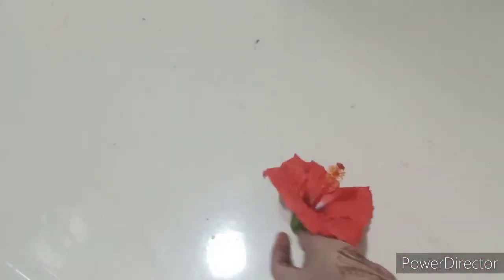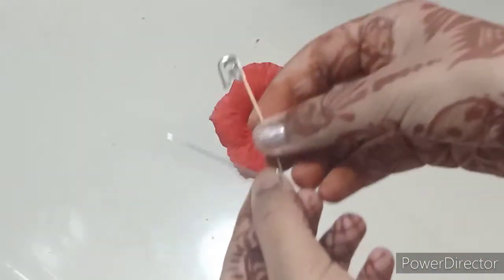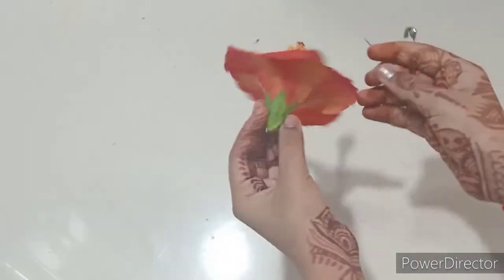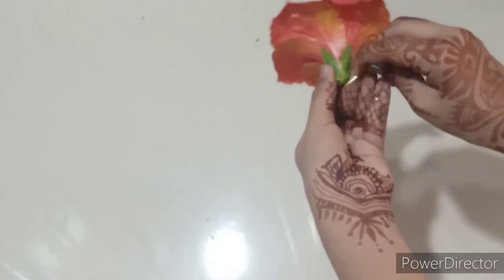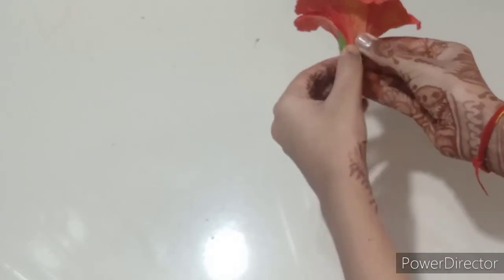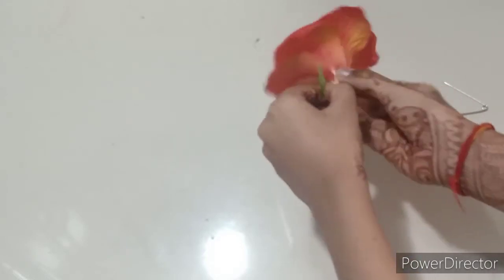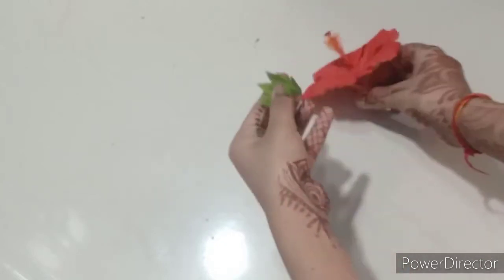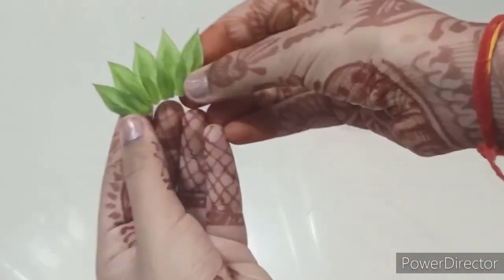To do this process, I am going to be using a safety pin, as you can see in the video. First, I will start by creating a slit at the sepals and bracts and start taking them out slowly. Here we have obtained the sepals and the bracts.